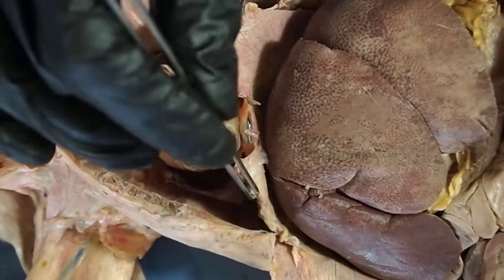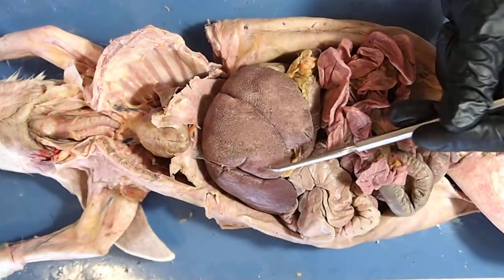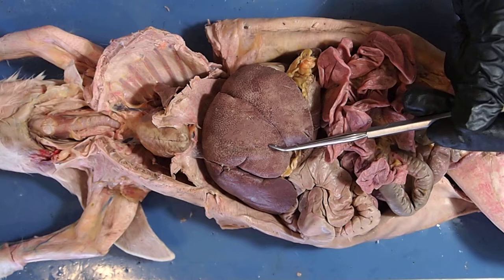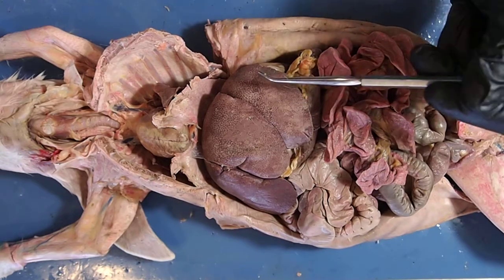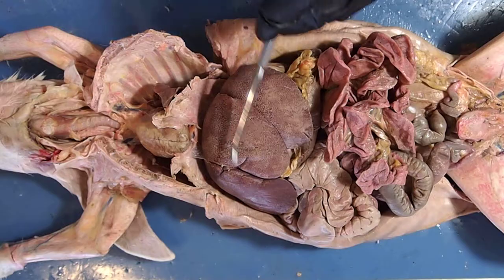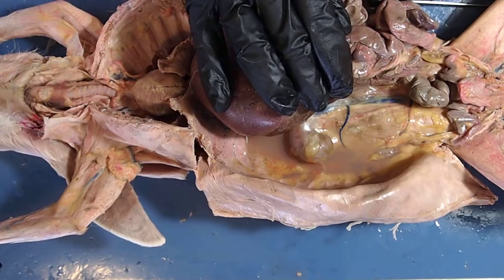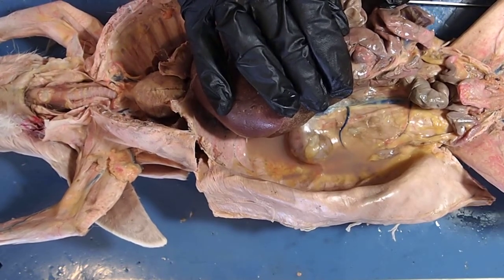Passing the diaphragm into the abdominal cavity, notice this very large organ taking up most of the abdominal space — this is the liver. I want to also revisit the concept of the coelom, which we discussed at the beginning of the semester. The coelom is the body cavity that accommodates the development of large, complex organs. If you removed all of these organs, you'd have a very large empty space — that's the coelom.